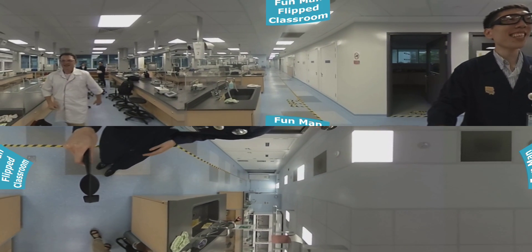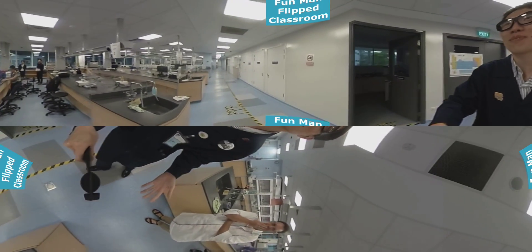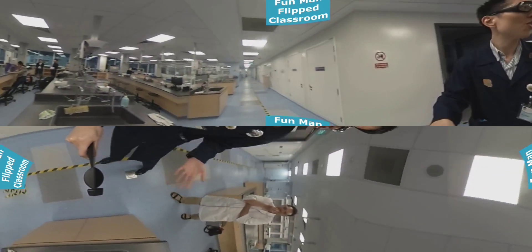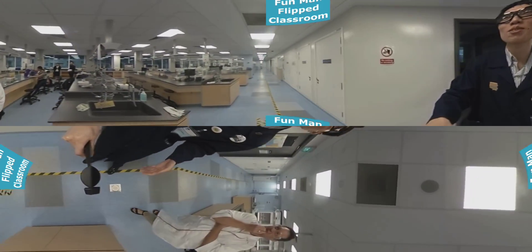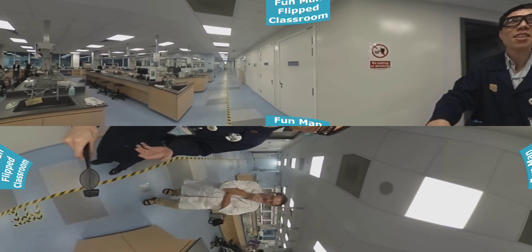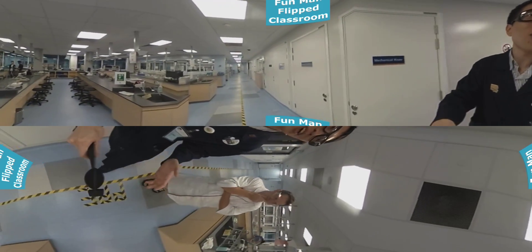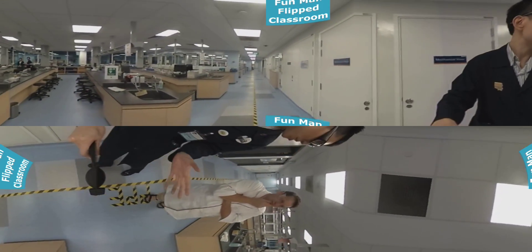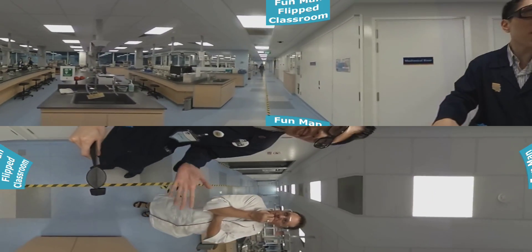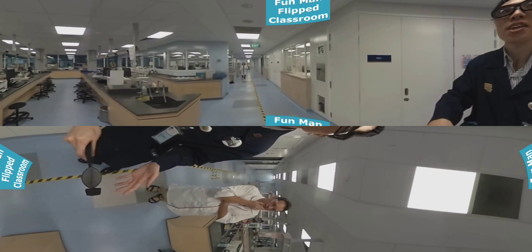Hello Simon, welcome to this lab. This is an analytical lab. This looks familiar. So let's tour the lab, okay? I'm going to ask you some questions, maybe silly questions, on the equipment and instruments here. Think of it like a mock viva.